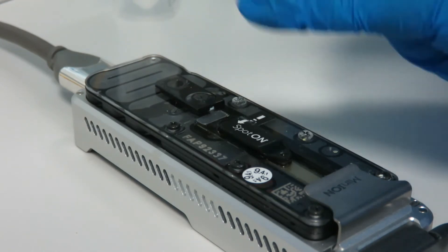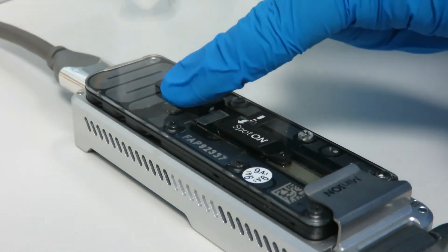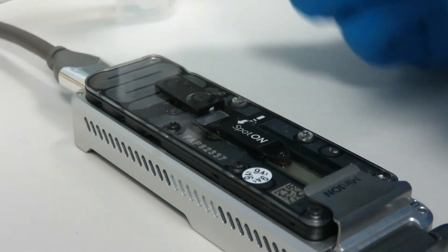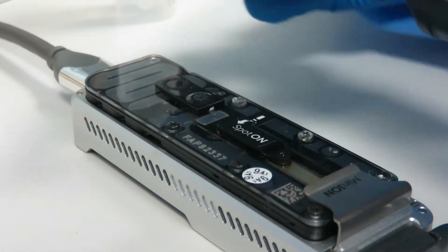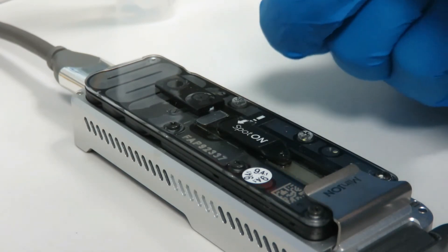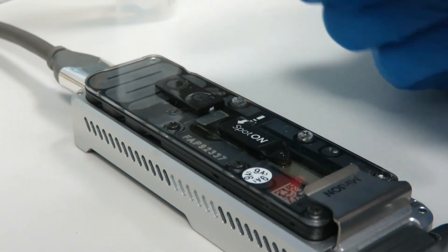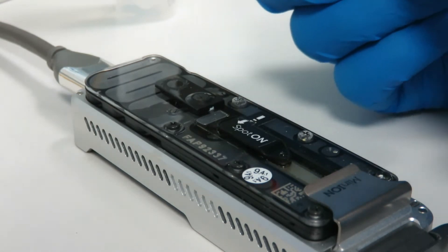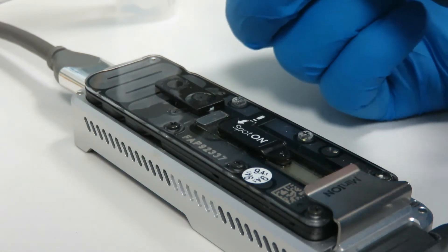Because these are old ones you might find that you already have some bubbles in your channel, but in new ones it should be entirely liquid from the entrance hole all the way down. Whenever you're loading buffer into a flow cell, I don't use the plunger — I always use the thumb wheel, because you have much better control. If you accidentally plunge a load of air in, you'll ruin your chip. The thumb wheel is a little slower but gives you a lot better control over the amount of liquid you put in.